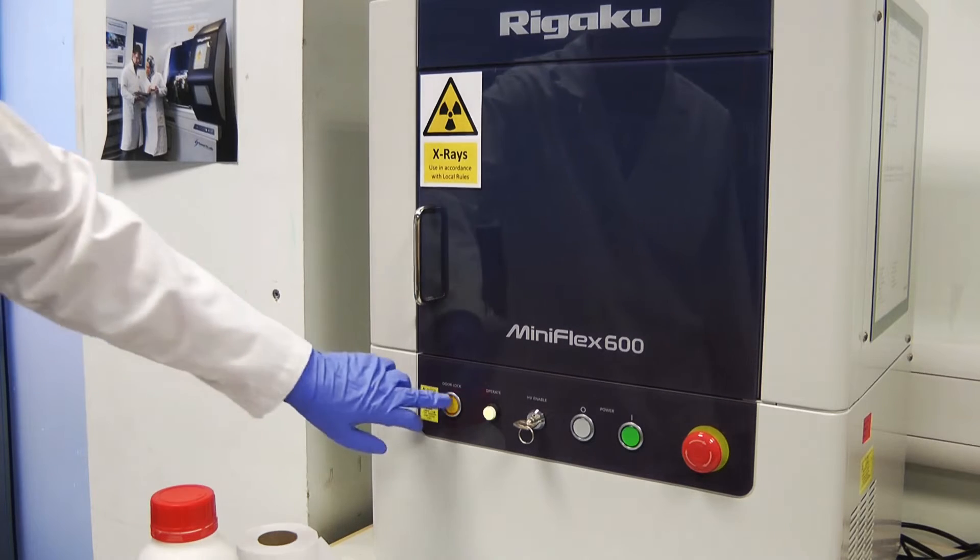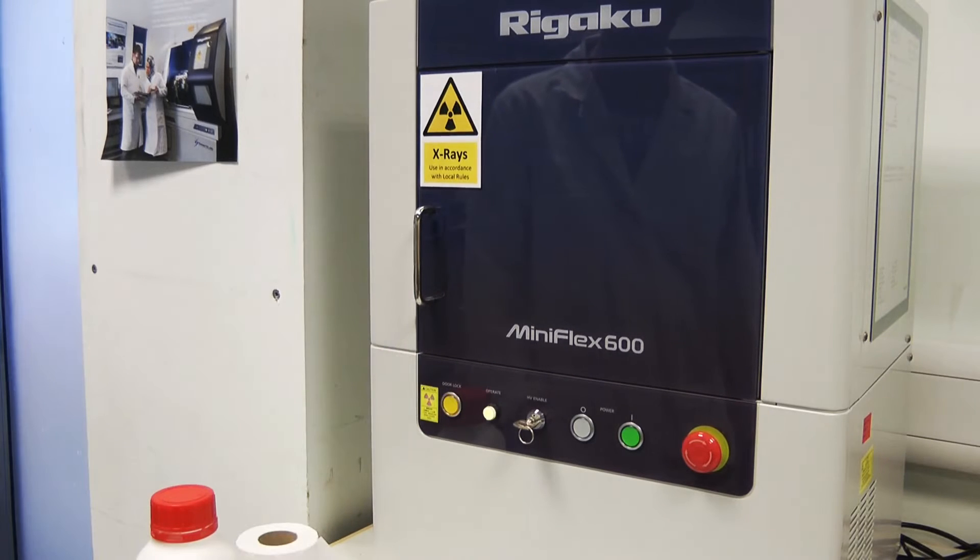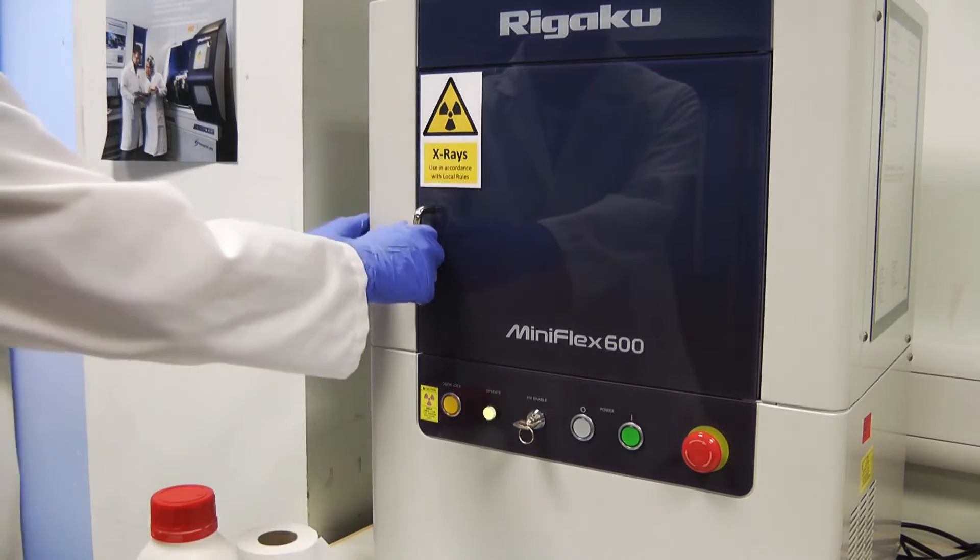To unlock the door, press the door lock button. An alarm will sound until the door is locked again.